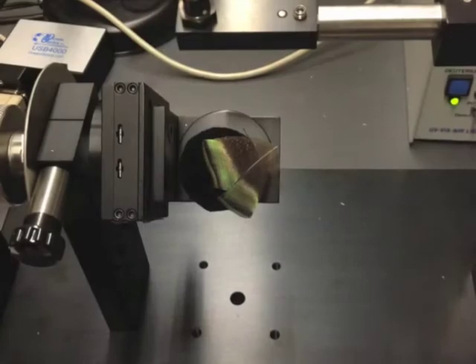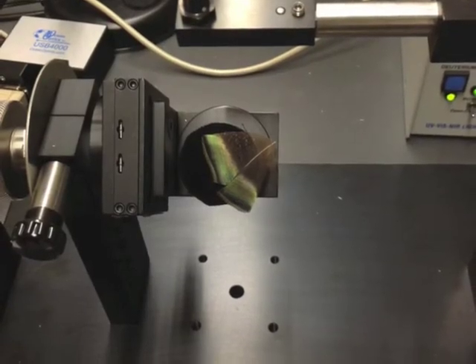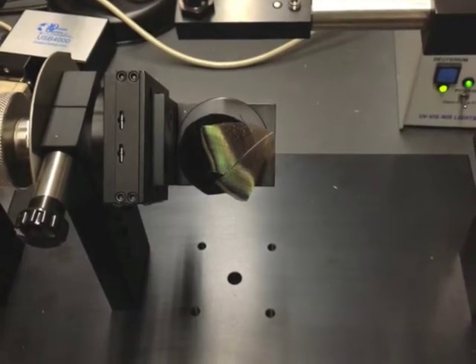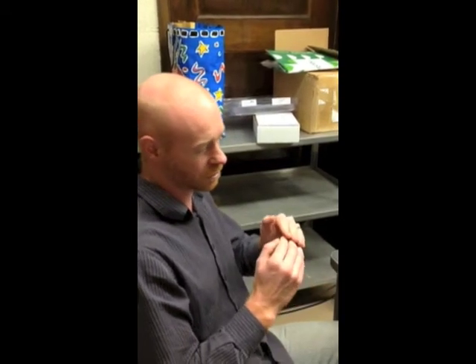Yeah. Very interesting. So what's the specific research question with this feather? In this case, what's really neat about the hoopoe and one of the other feathers I was measuring off of a turkey today is that they have hollow melanosomes. So a lot of birds have solid melanosomes. They're usually rod-shaped. These are hollow, and it offers quite a bit more reflectance normally, so a bit brighter in the feather. But also it seems as though with a change in angle geometry, we're getting not only a change in color, but sometimes a complete change in hue. And so we get a peak not only shifting, but it jumps from one hue to another.